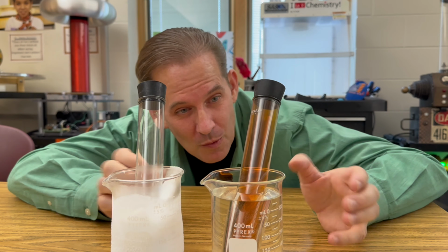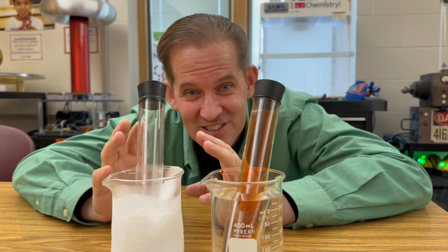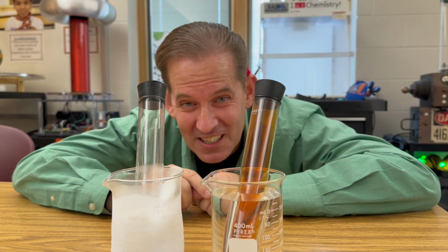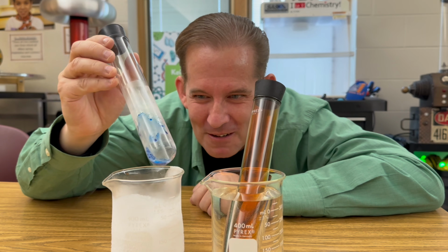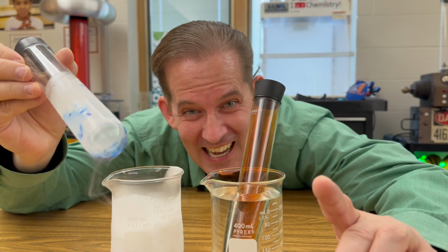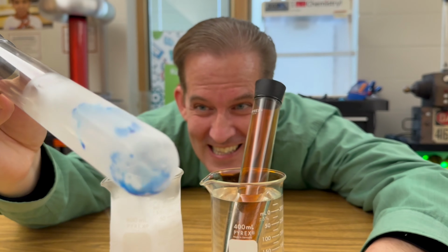Okay, what's going on at this point is I still have nitrogen dioxide gas over here, but over here it's changed, the equilibrium has shifted and it's become dinitrogen tetroxide. But when I take it out, look at the bottom. It's blue. That's where it changes into dinitrogen trioxide. Look at that. Isn't that amazing?